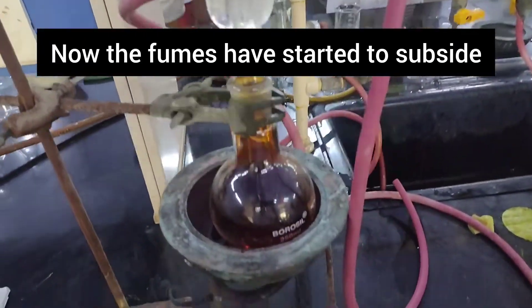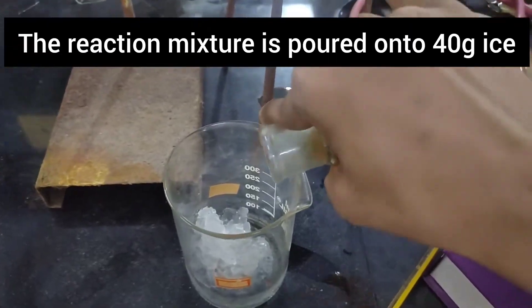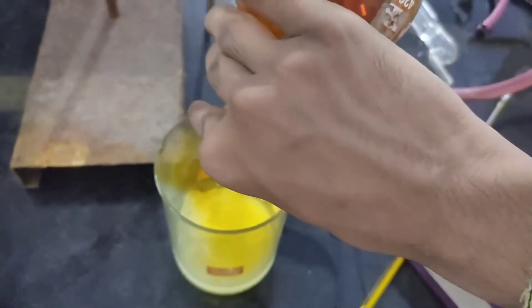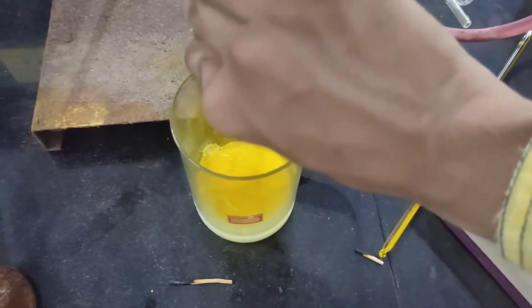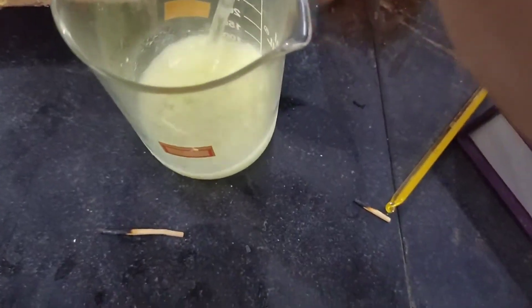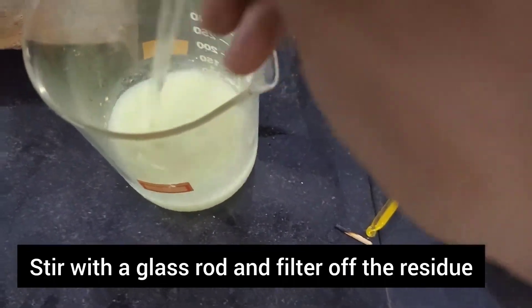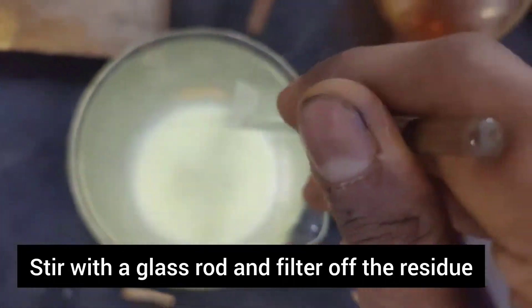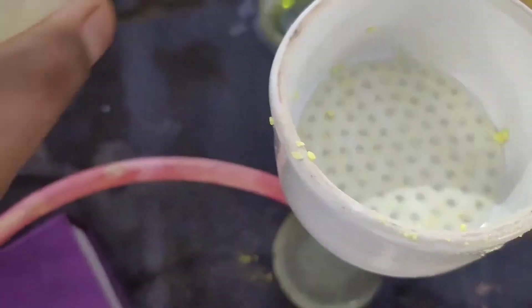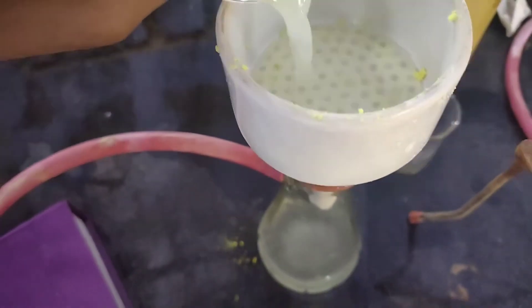After 19 minutes the fumes have started to subside, so the reaction mixture is poured into 40 grams of ice, and the mixture was stirred well. The oil crystallizes in the form of a solid. The crude benzil is filtered through a Büchner funnel.